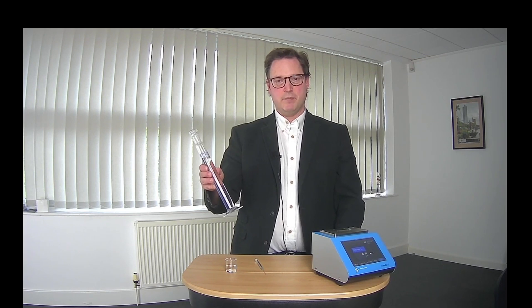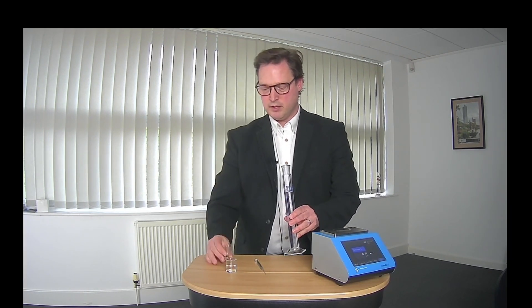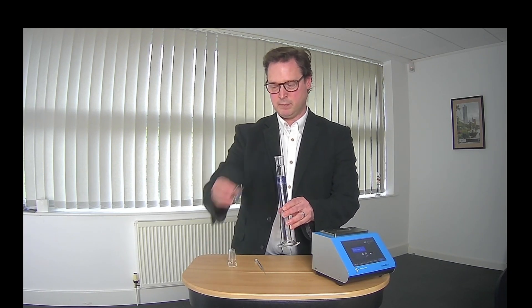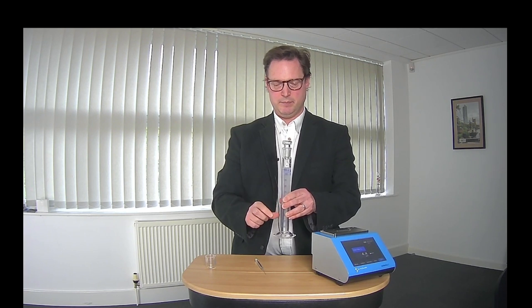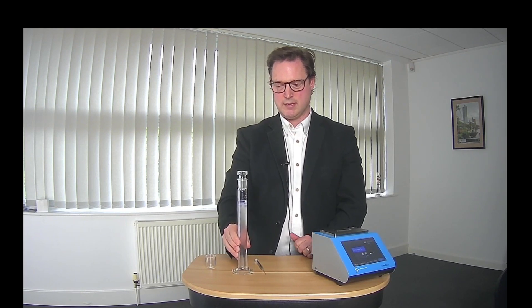In my measuring cylinder here, I have 100ml of the sample I want to test, and to that I'm going to add 10ml of hexane. I need to give it a shake for maybe 10 or 15 seconds, and what happens during this part of the process is that all the fat, oil and grease in the water sample is absorbed into the hexane layer. You'll see now that the sample is separating out, and the hexane layer on the top contains all the fat, oil and grease that I want to quantify.